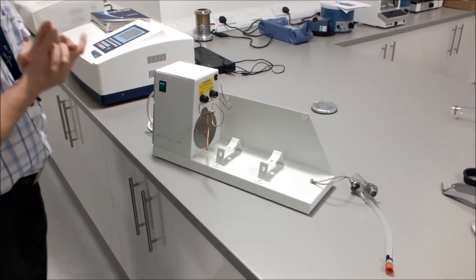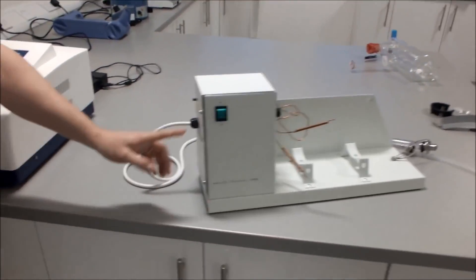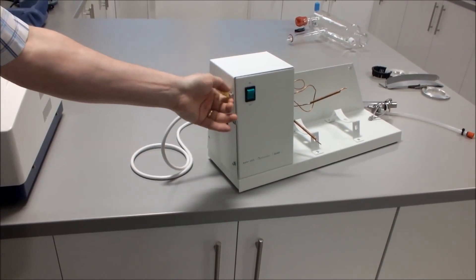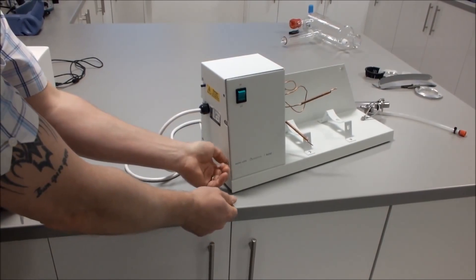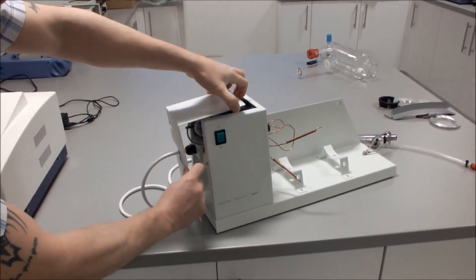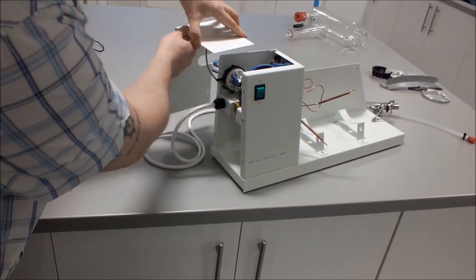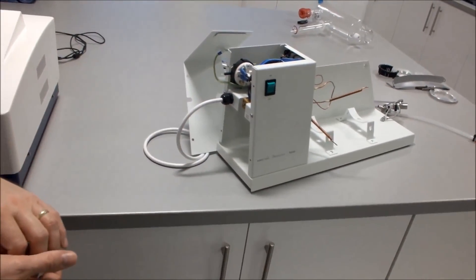The first thing to do is take off the end panel by undoing the four screws. When you take the panel off you will see that it is captivated by an earth cable. Take that off and put it to the side.